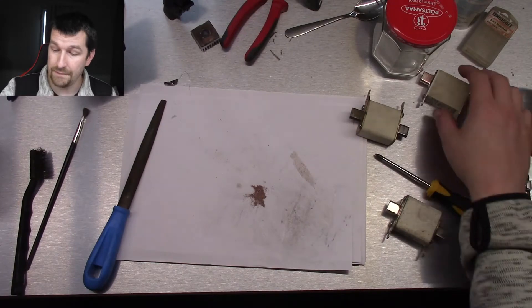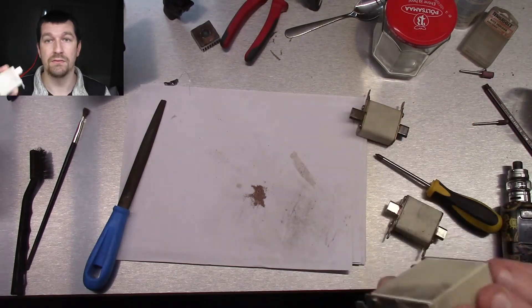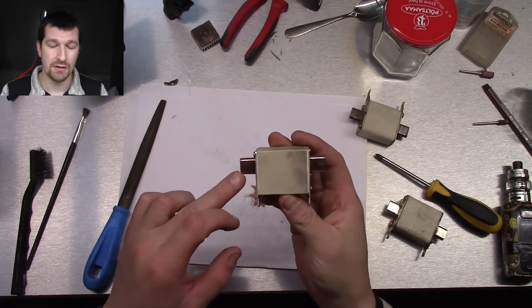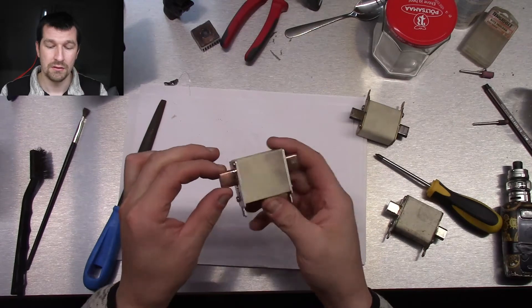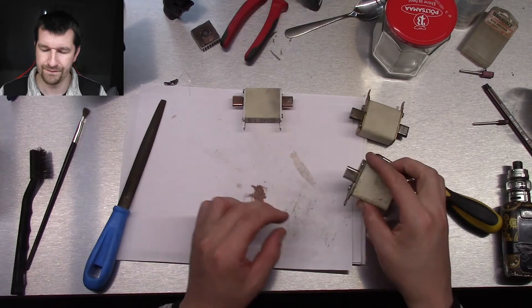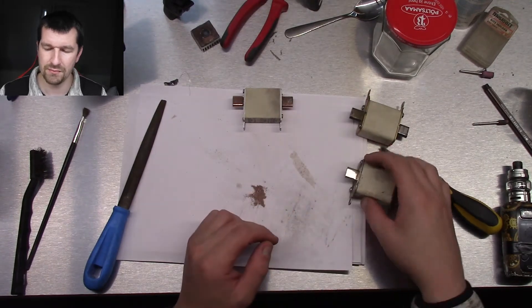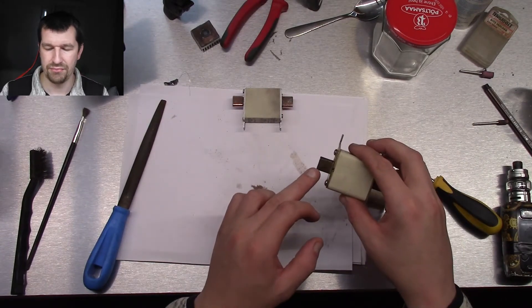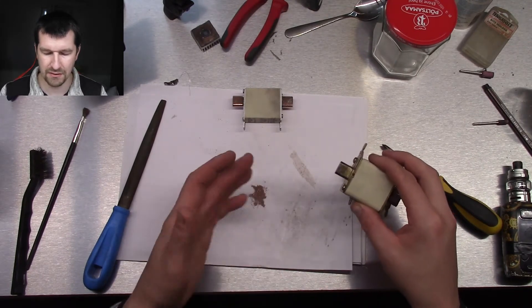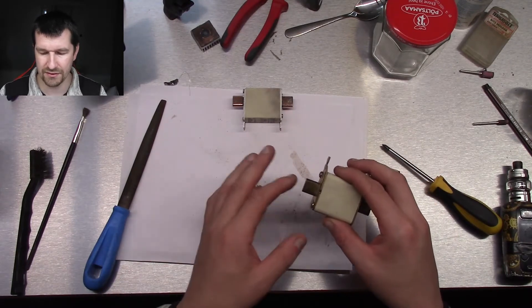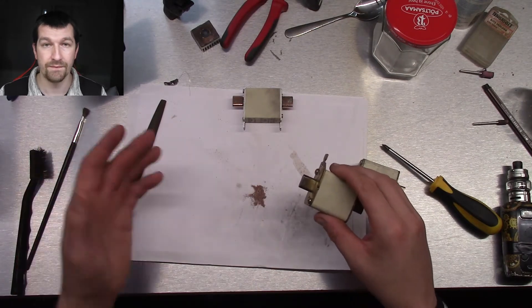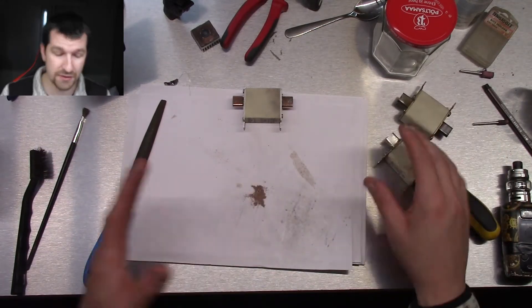Okay, turned out that only one of that fuse has actually copper on it, and the other ones looks like they do have a silver coating, but that silver is on brass. I don't want brass in here. It may be contaminated a little bit, but it's okay because I don't know what vinegar does to brass.